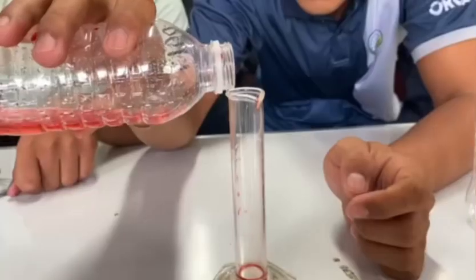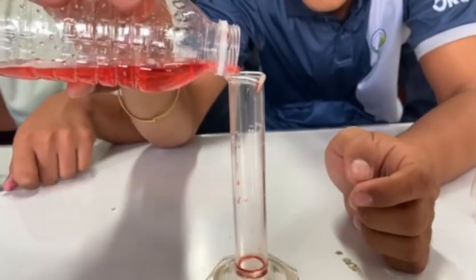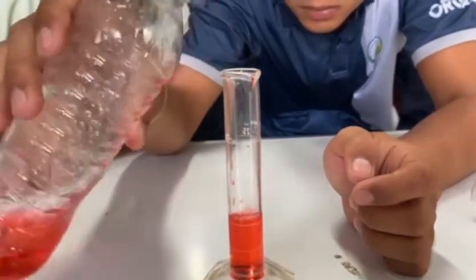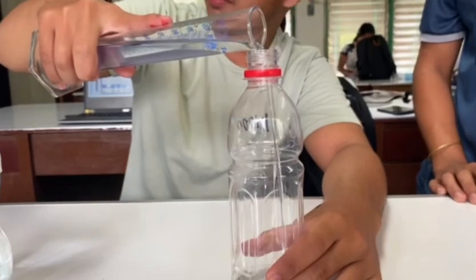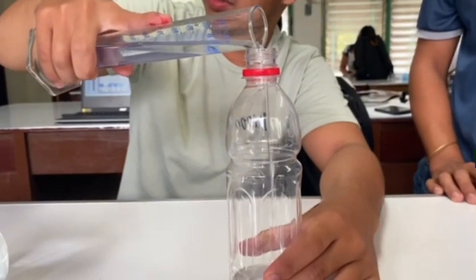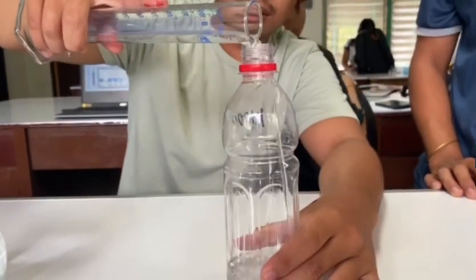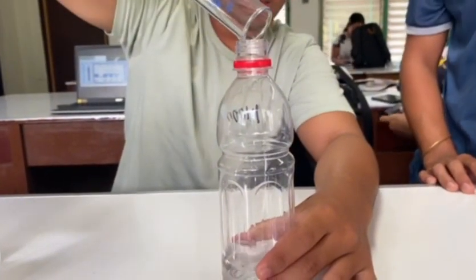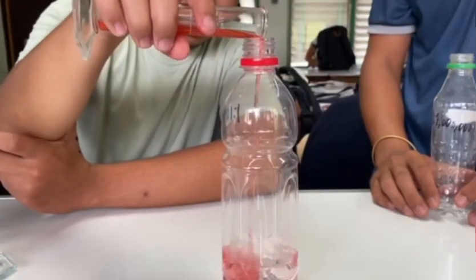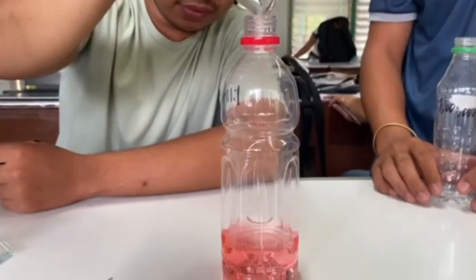Then, again, we take 10 ml from the 1 to 100 dilution, or 10,000 ppm, and dilute it with 90 ml of water to make a 1 to 1,000 dilution, or 1,000 ppm.